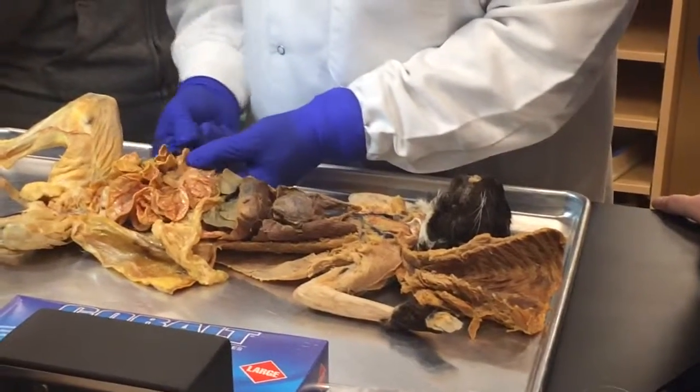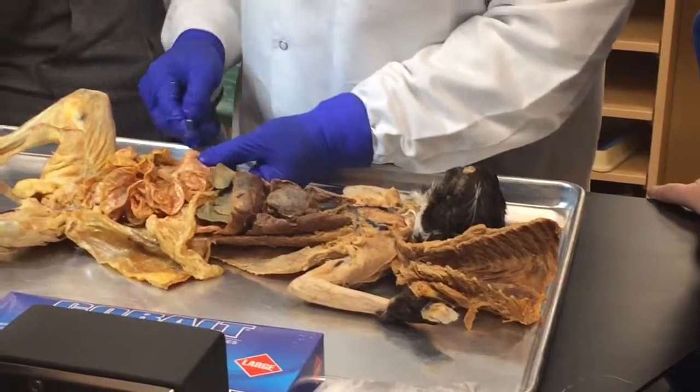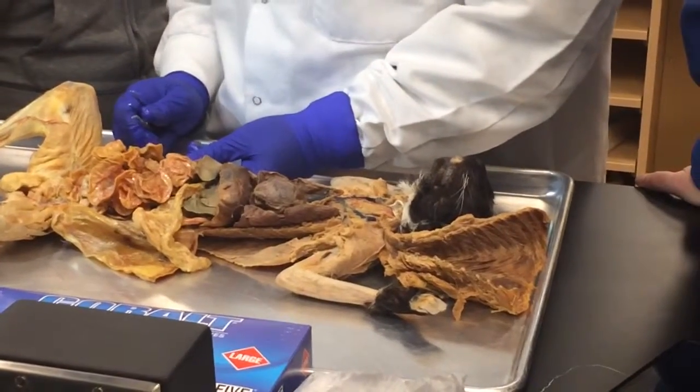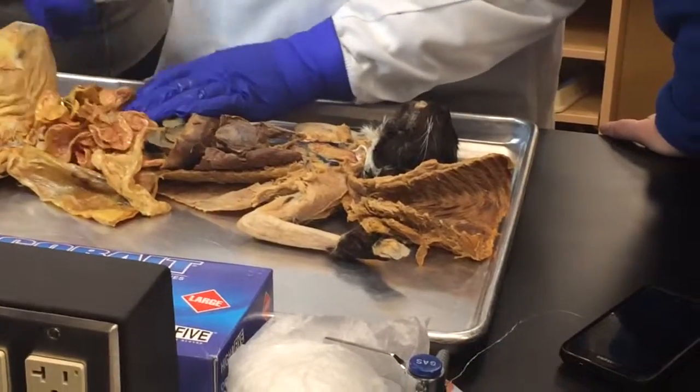So if I put a sticker very close to the colon, that will be the ileum, right? And then how do we even know when it's tagged that this is part of the small intestine, this is part of the large? Because in the human, you can tell right away because of how the colon is structured, but here you can still tell.